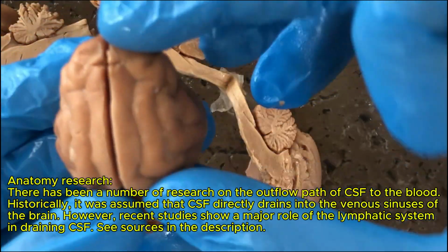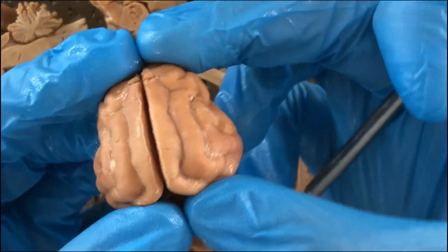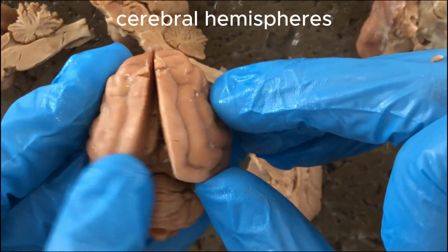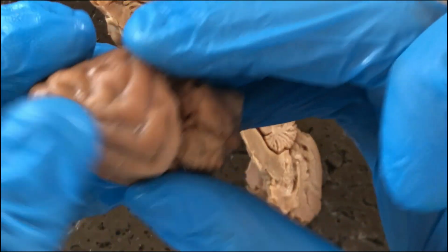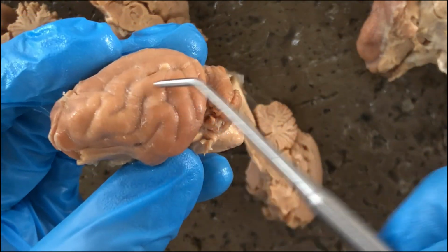Right, so let's examine the dorsal structures first. In the mammalian brain, the most prominent structures that you'll see are these 2 parts here called the cerebral hemispheres. You have the left and the right cerebral hemispheres. And the cerebral hemispheres of mammals are characteristically convoluted, kind of like intestines, right?